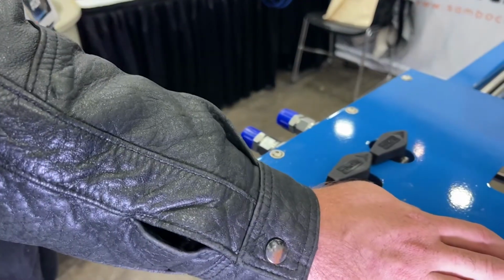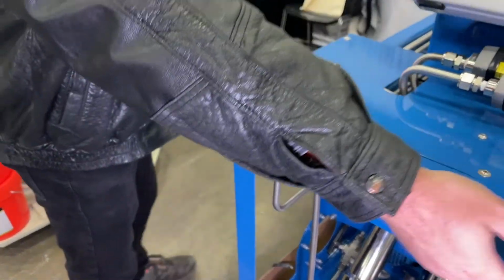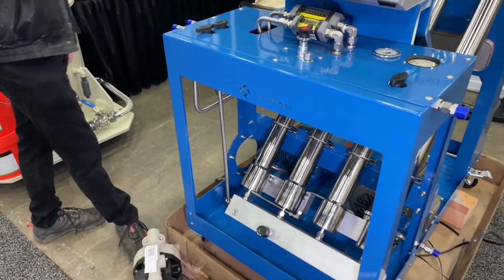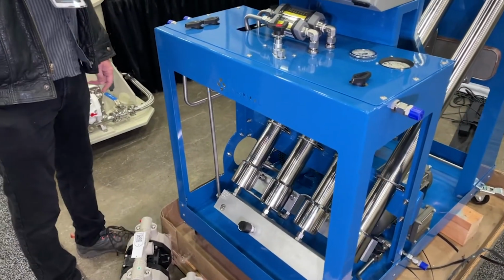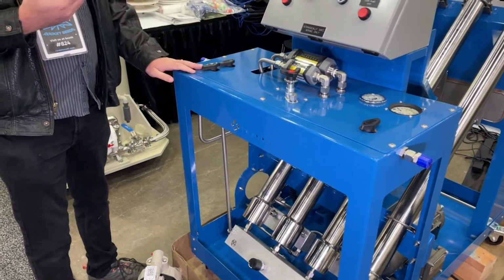On every pass, a certain amount of fluid leaves the system and is replaced by new feed that is topped into the loop by the feed pump. In that manner, the operation is run continuously with new fluid constantly being fed and split into the filtered and unfiltered components.